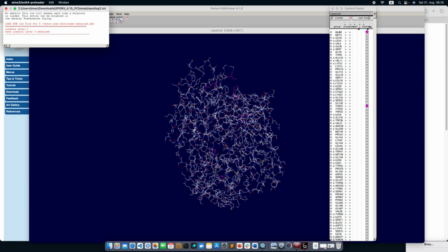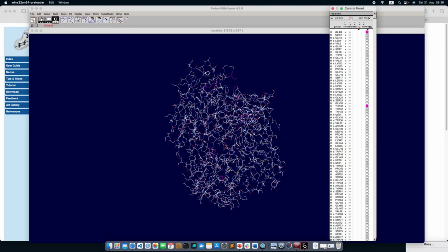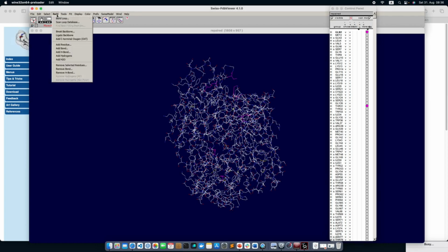When you try to open this particular PDB file in MGL Tools, no prompts will pop up saying that there are some missing atoms. I would recommend everyone to first open your PDB file in Swiss PDB Viewer and then go for opening the PDB file in MGL Tools for molecular docking analysis. And not only can you add atoms, but you can also add residues as well. So here, if you go to the Build section, there are some options to add residues as well. Thank you very much.